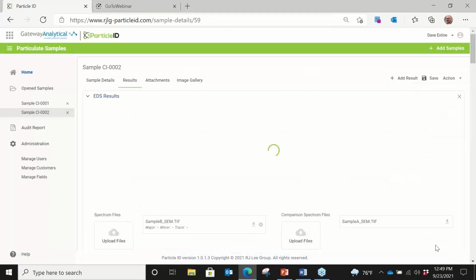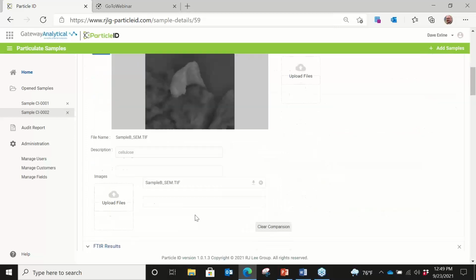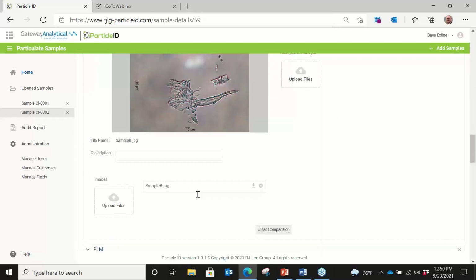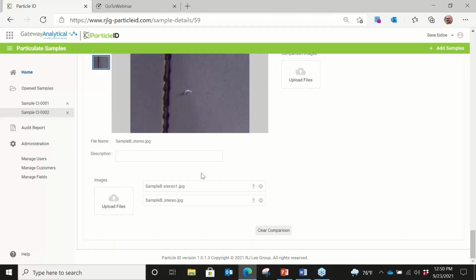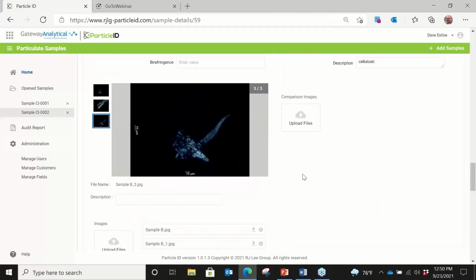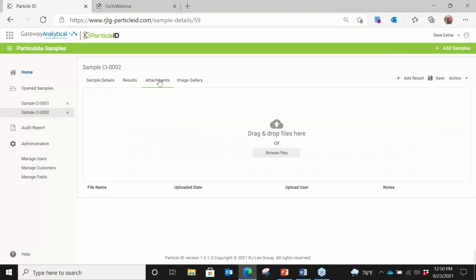And it's simple as clearing that, setting something else as the primary sample. And again, it allows us to really do side-by-side comparison in anything that we want to do from an analytical standpoint. So we're really not limited in the types of comparisons that we can do. We're only limited by the data that we're able to get into the database.